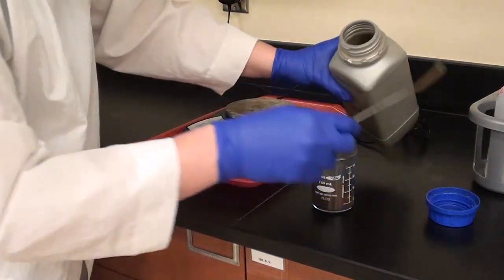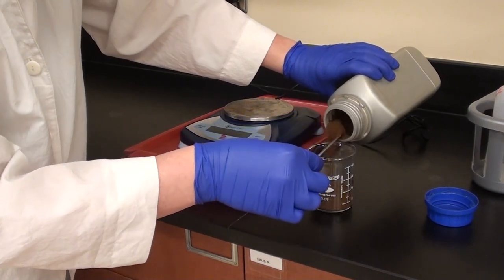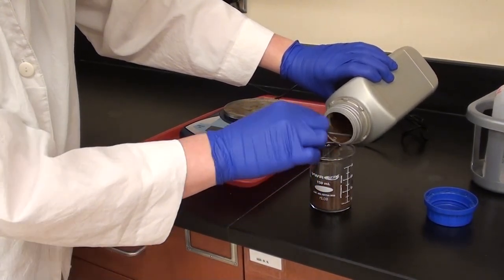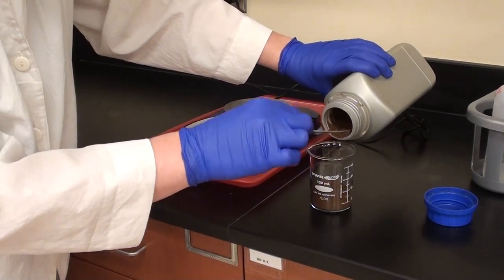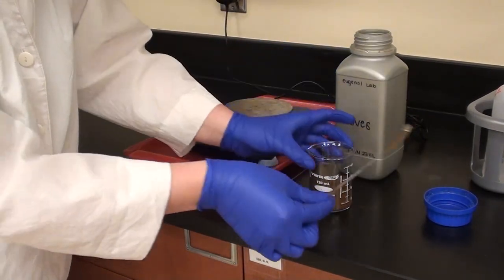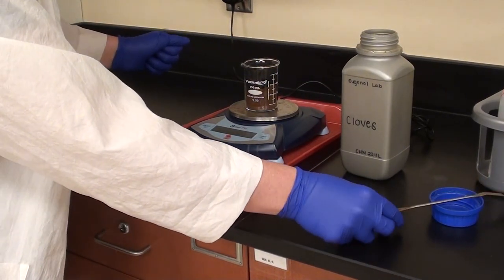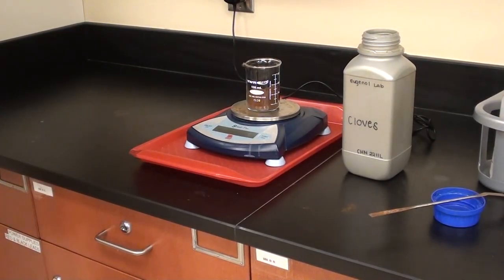So she knows pretty much about how much more to add. It doesn't have to be exactly 25 grams, just anywhere in that ballpark. Maybe anywhere between 23 and 28 grams would be fine.